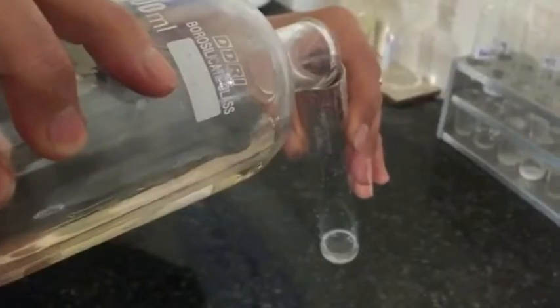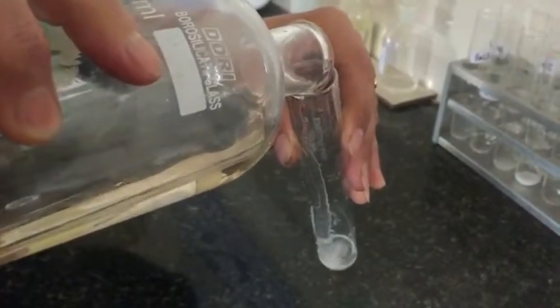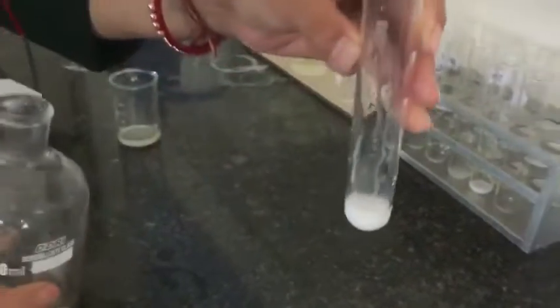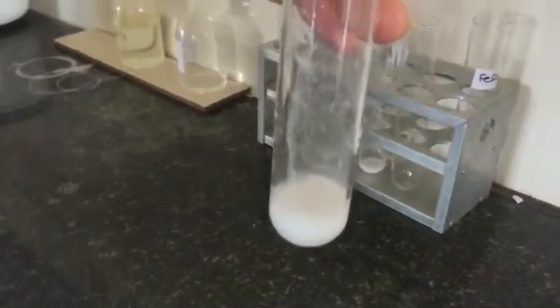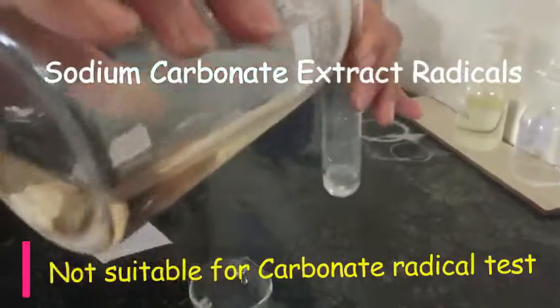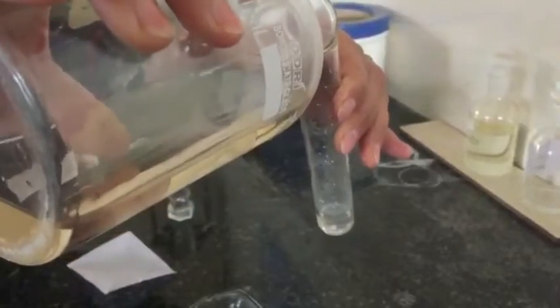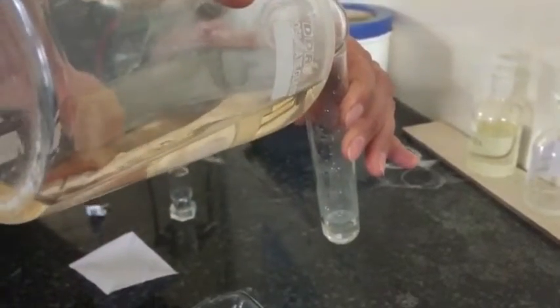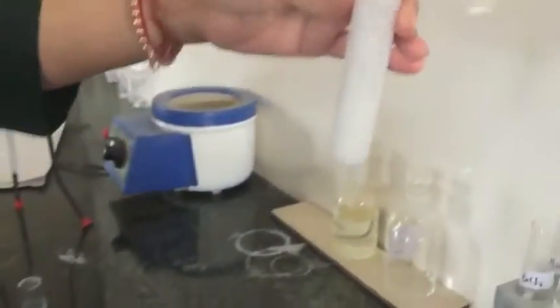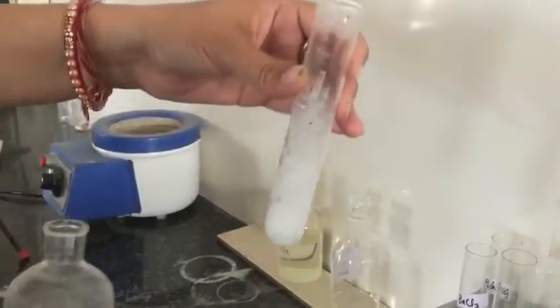Here I am showing you the experiment. I have taken lead nitrate, and if I add the group reagent dilute sulfuric acid, it gives the precipitate of lead sulfate — therefore we cannot perform the acid radical test directly. Limitation: this sodium carbonate extract is not suitable for the carbonate test because it itself gives the carbonate test.